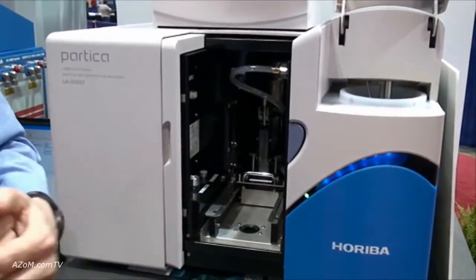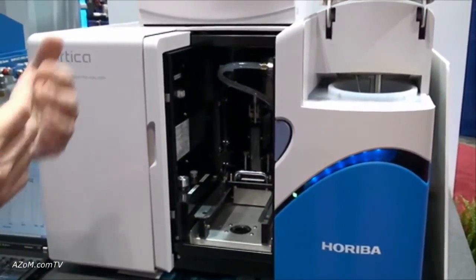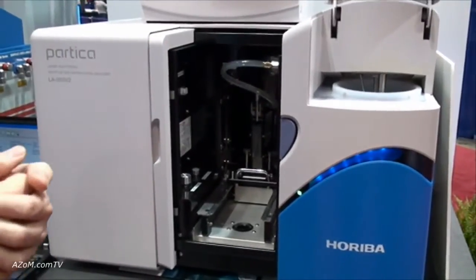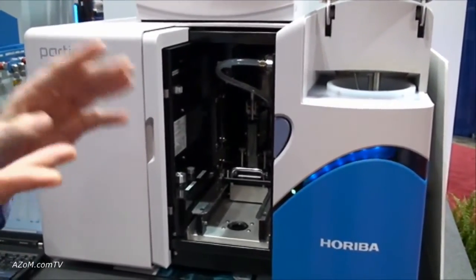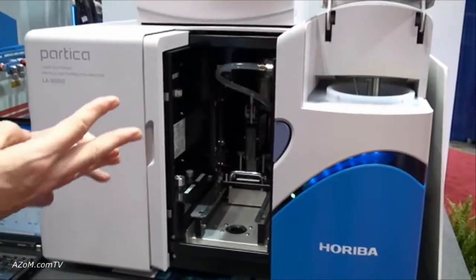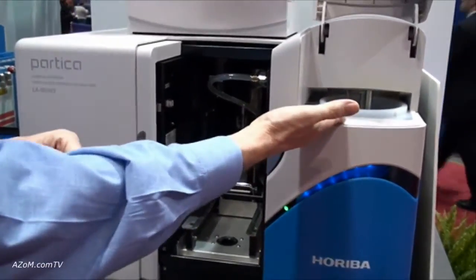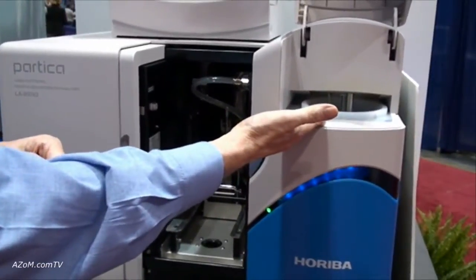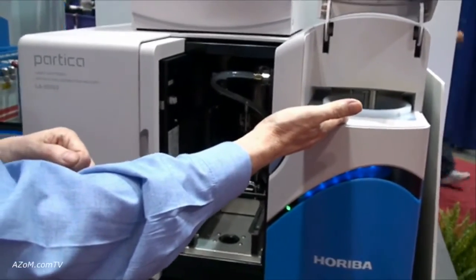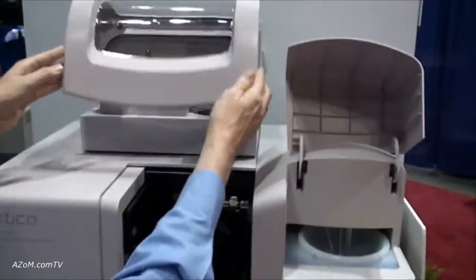We might also have samples where we're measuring dry powders — anything from a pharmaceutical powder, sugar, or cement. To measure it as a powder we have two options: we could introduce it as a liquid suspension, or we could switch the system over to use the dry powder feeder.